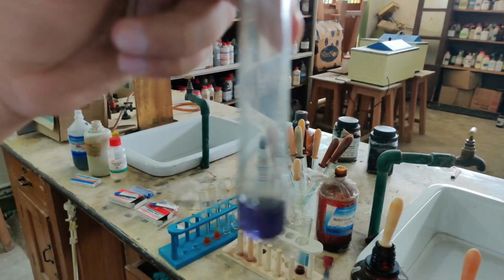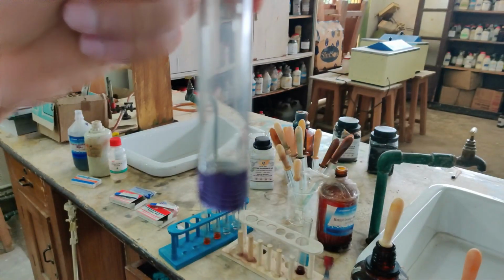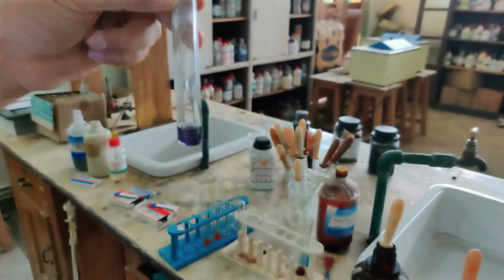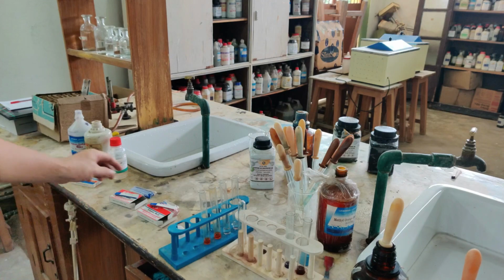Now so this one was a blue litmus turning to red and a red litmus turning to blue. So now a very nice blue is what it has turned to. Now if you see it again carefully, I showed you just now with the solution, but then we also discussed the paper. So let's see about the paper.